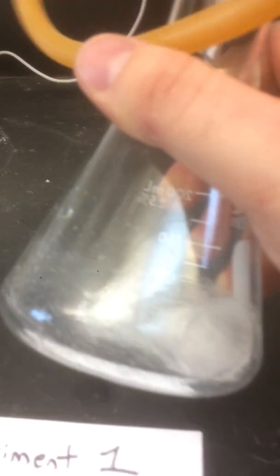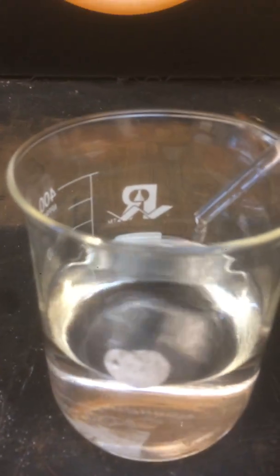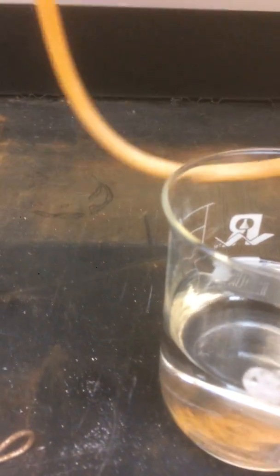Okay, and I'm just basically going to let these run. A little piece in there, so just bear with me for a minute. You could always fast forward, but I'm just going to let this video run until it's done. Okay, and I can tell if it's done if the water stops coming out. So it's still dripping out, so that means the reaction's still going on, still making carbon dioxide. You can see the water is getting displaced. And over here, we're still going, still bubbling away.